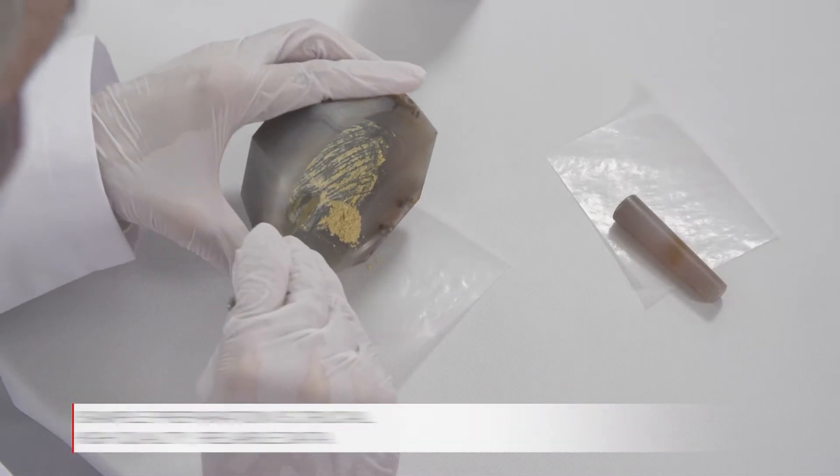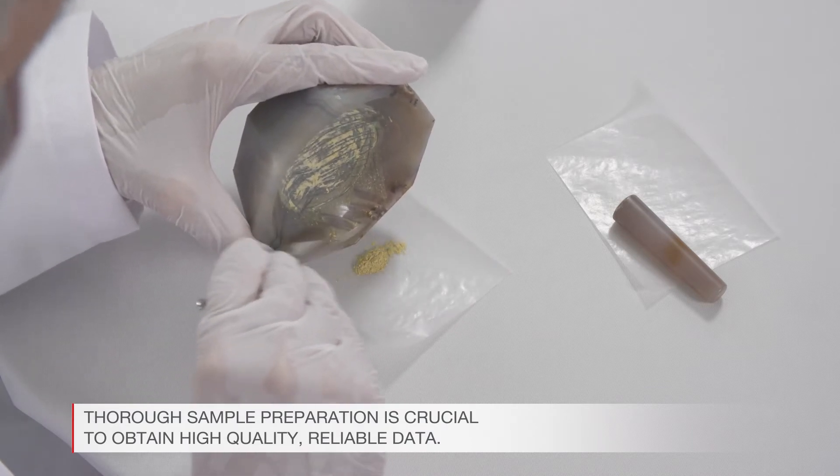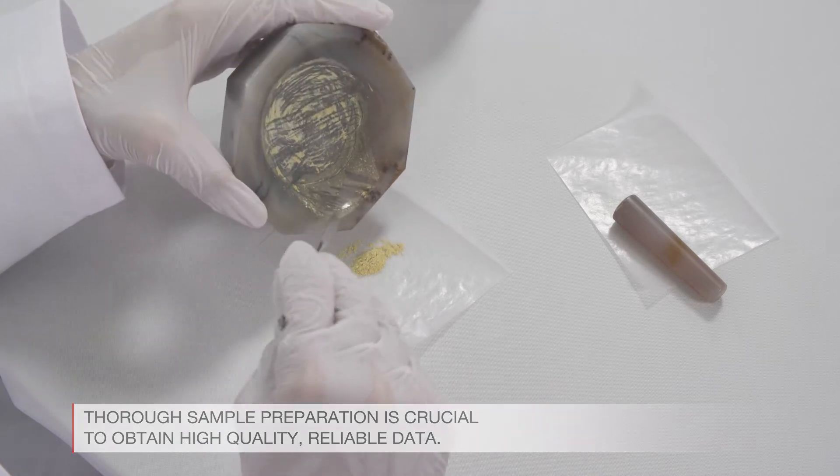For XRD analyses, one has to make sure to use fine enough powder. Therefore, thorough sample preparation is crucial to obtain high-quality, reliable data.